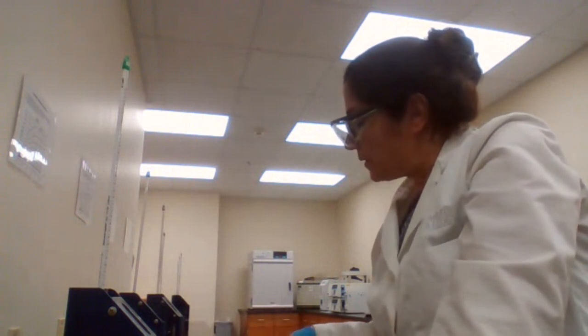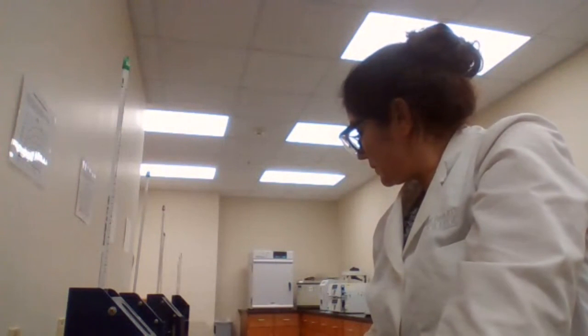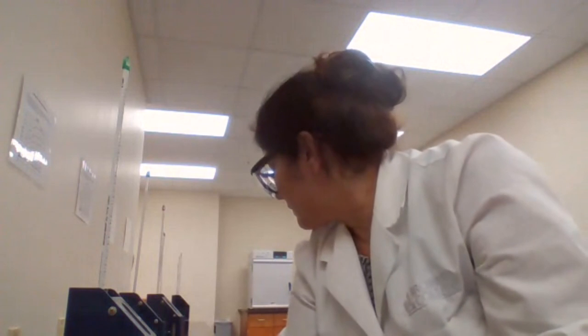Ketones in the hard copy is 233 for me. 233, 234.